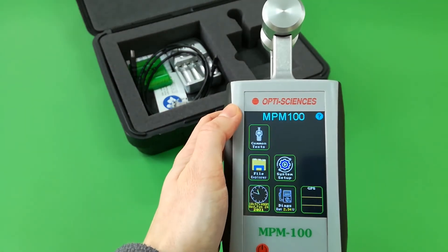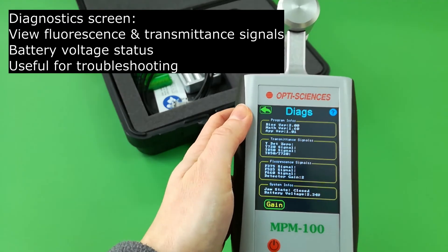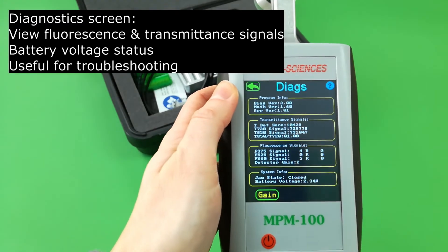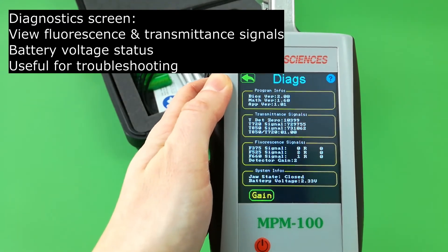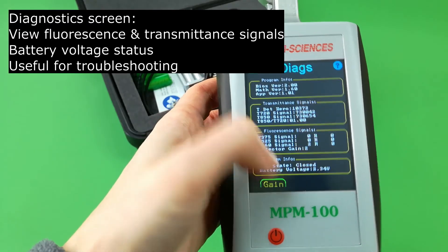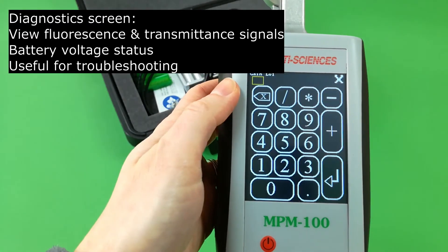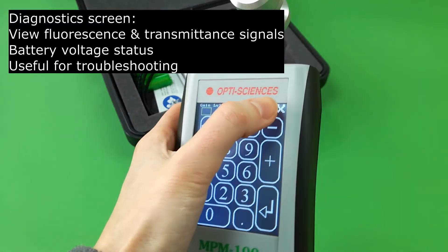The diagnostics screen allows you to view fluorescence and transmittance signals and battery status. The fluorescence gain level can be reset here.